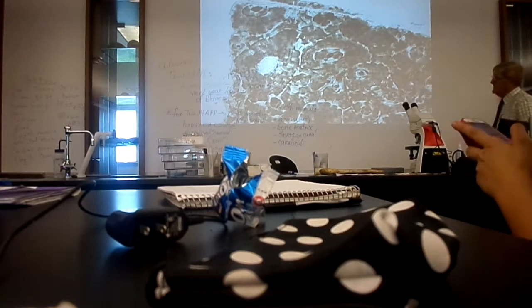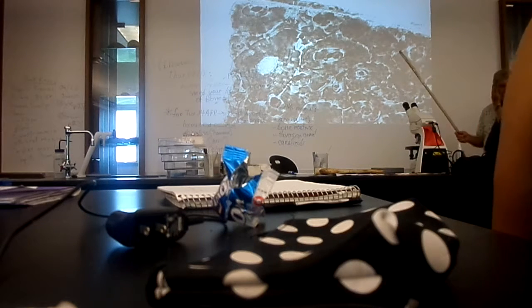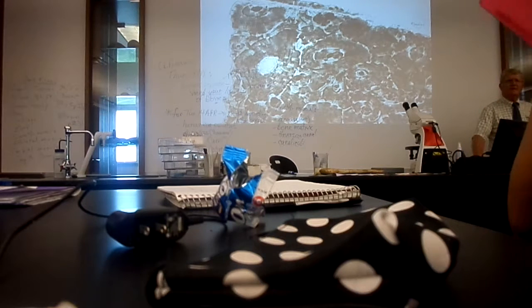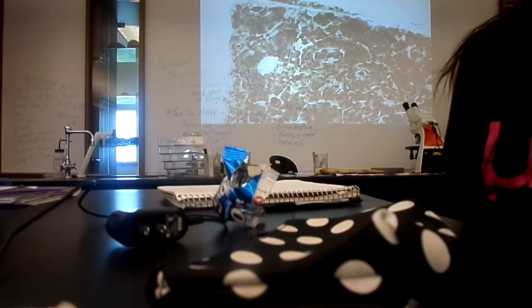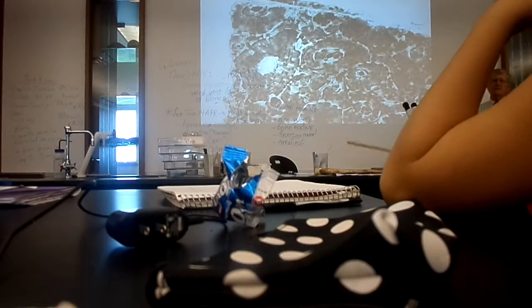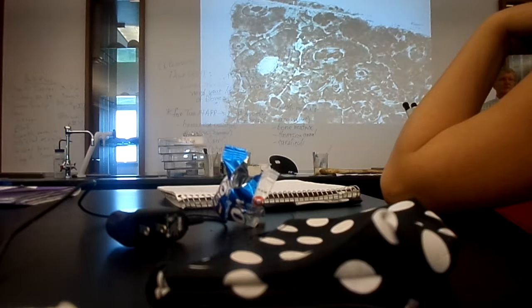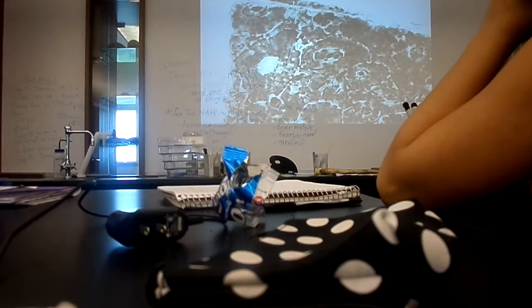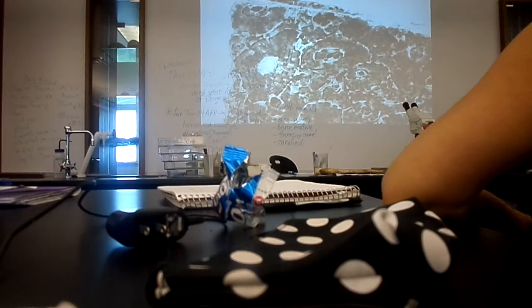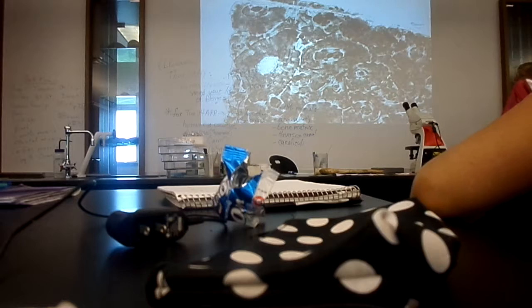Now, what I hope will catch your attention about this bone tissue slide is that bone tissue is not composed of a bunch of cells like you have been looking at previously in the epithelial tissue and the muscle tissue and whatever other tissues you've looked at. There are no cells for you to see on the bone tissue slide because they're not there. When this tissue was alive, there were bone cells present, but that slide is very old and the cells have deteriorated. They're gone. I will be able to show you where they were, but they aren't there anymore.